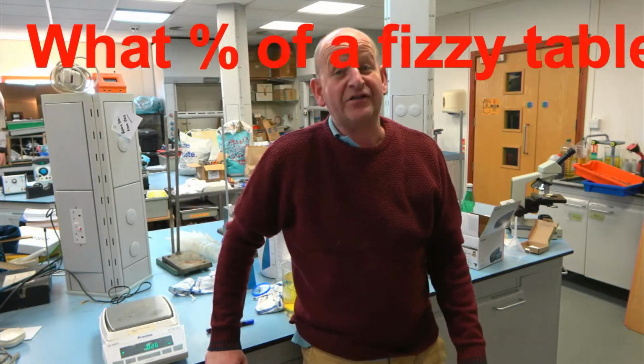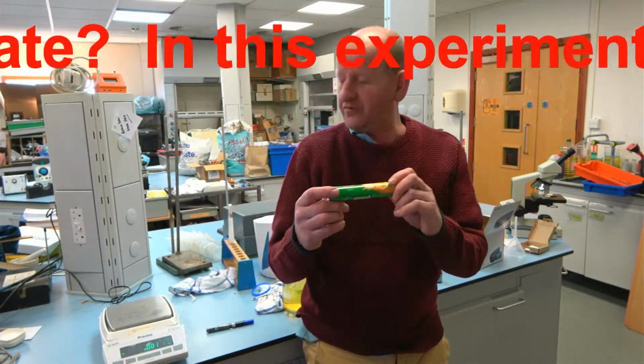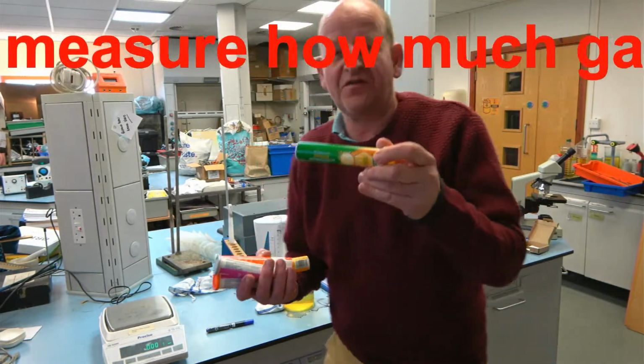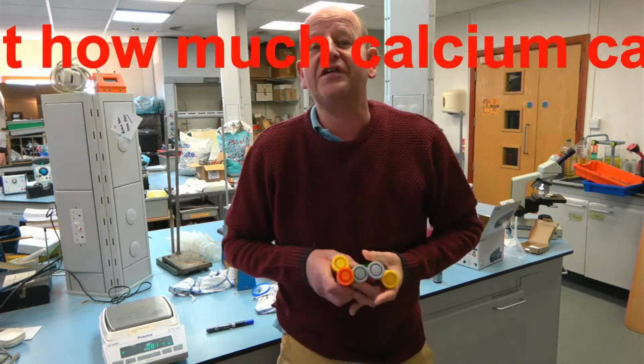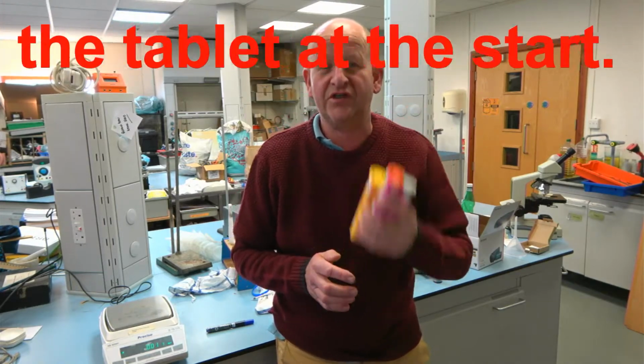Today we're going to do a bit of analysis and introduce moles and a bit of chemical equations, and we're going to go to our old favourites, the tablets. I've got a variety of them here, so I've got that one and that one and that one and that one. You can use any of these effervescent tablets; you can get them from all major supermarkets. They're quite cheap to use.